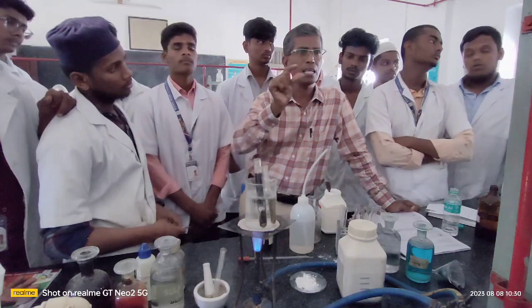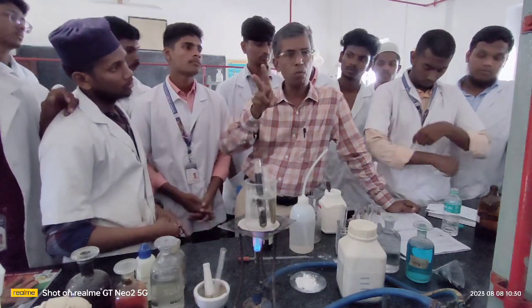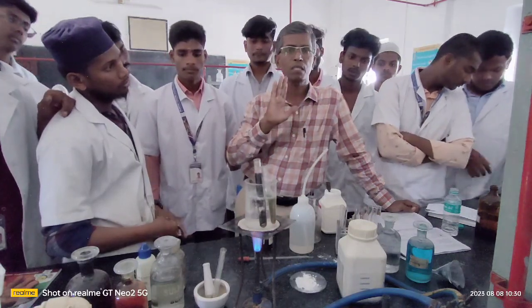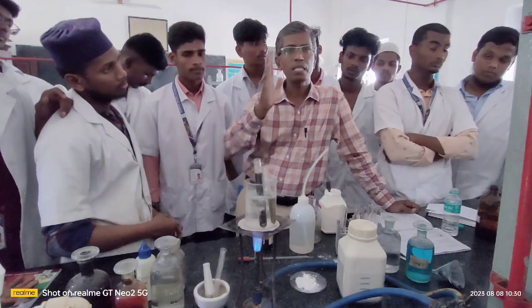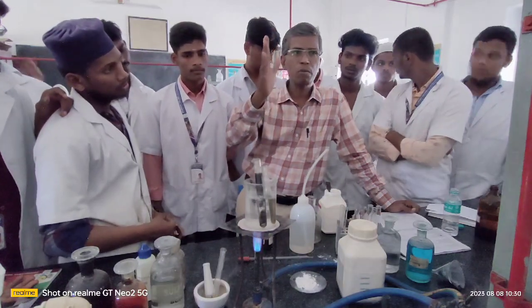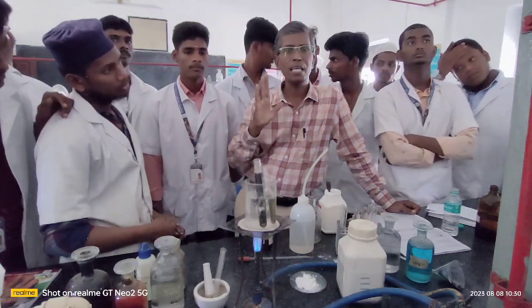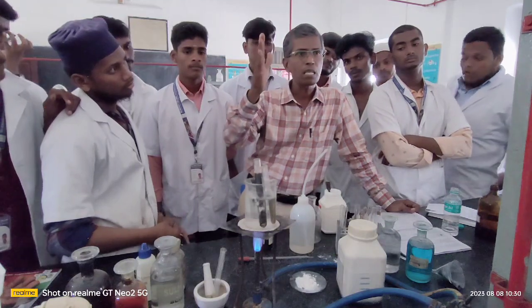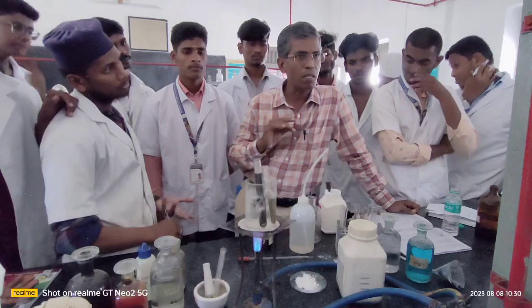potassium permanganate or bromine water. In both, both are colored solutions, and the color will disappear. That confirms the presence of unsaturation. The disappearance of the bromine water color or the potassium permanganate color is because of the addition reaction of bromine and potassium permanganate across the carbon-carbon double bond.